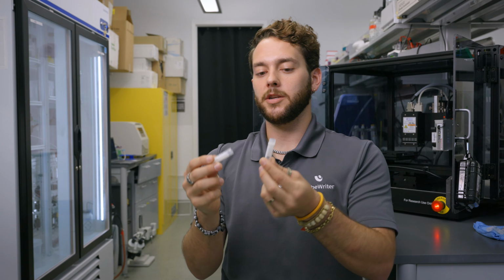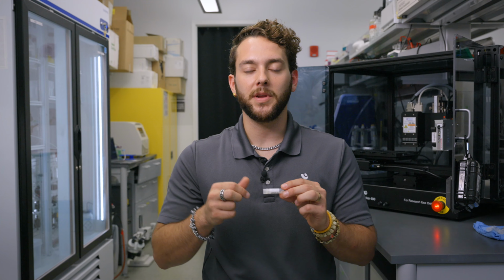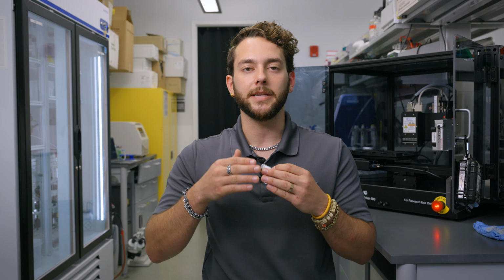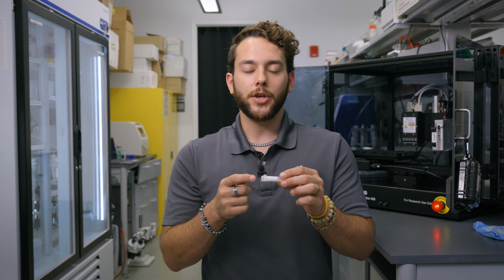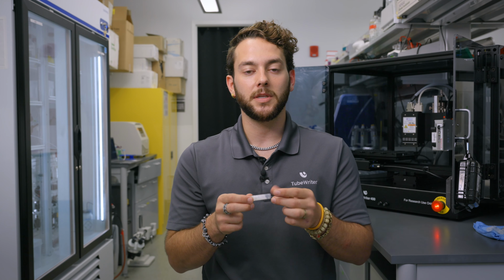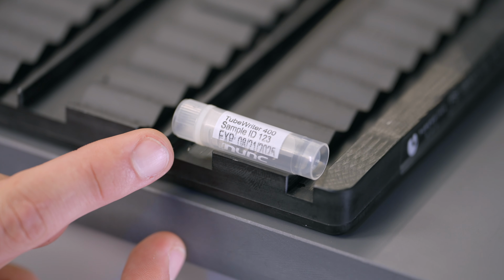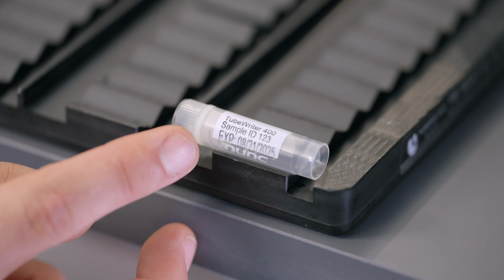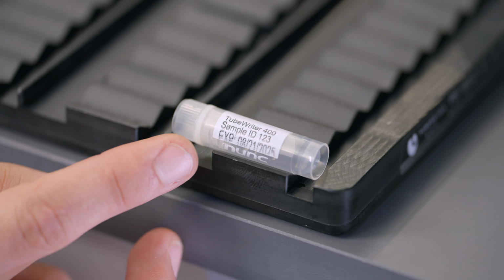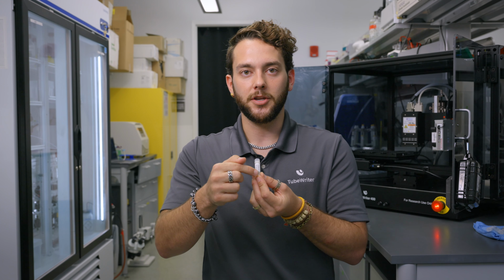So that's one way you can adjust the print location. If the text that's printed on the tube, whether it be the top line, the bottom line, looks to be a little bit warped or is stretching, what you'll want to do is adjust the distance between rows and distance between columns. With this example, the last line of text was stretching a little bit and looked a little bit warped. So what I did is I decreased that distance between rows to move the text up, because our goal is to aim for the middle section of the tube.